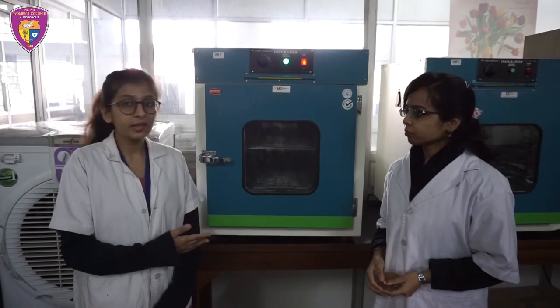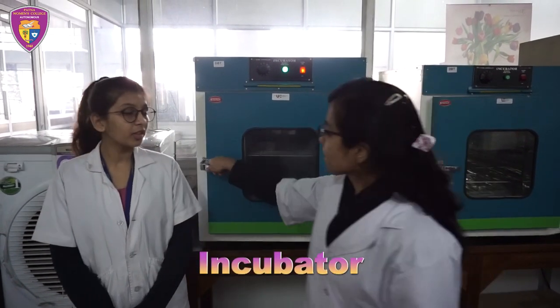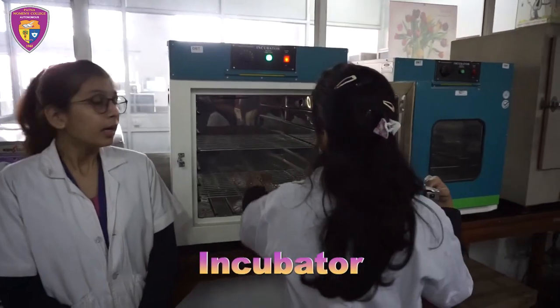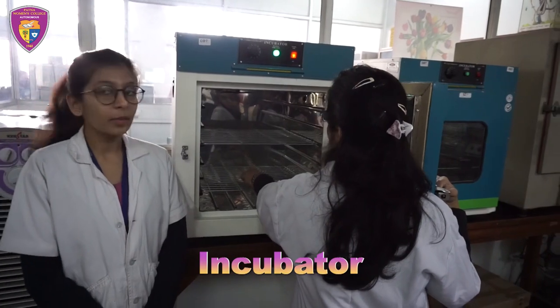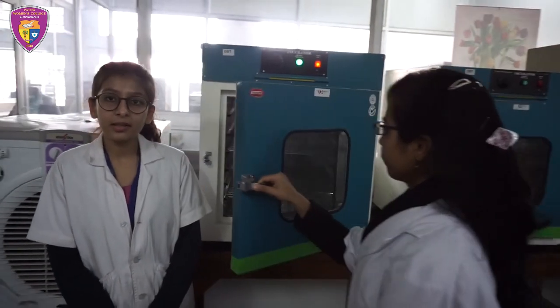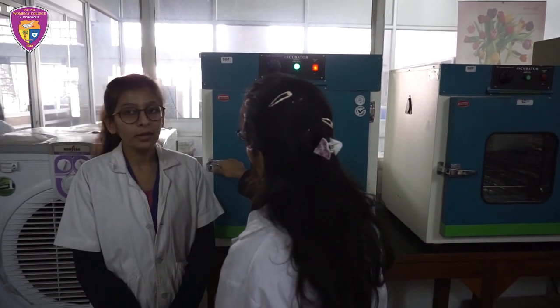This device is known as an incubator. It is based on the principle of thermoelectricity. The incubator has a thermostat which maintains the optimal temperature by creating a thermal gradient.